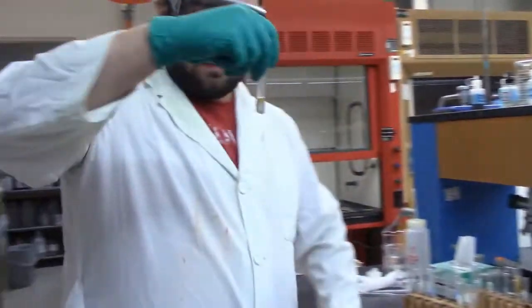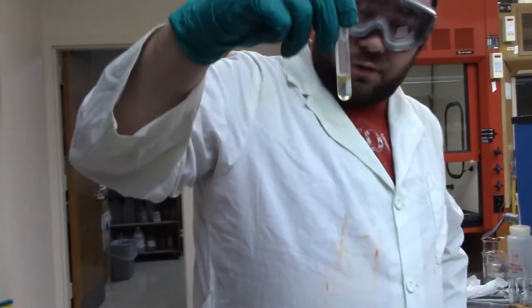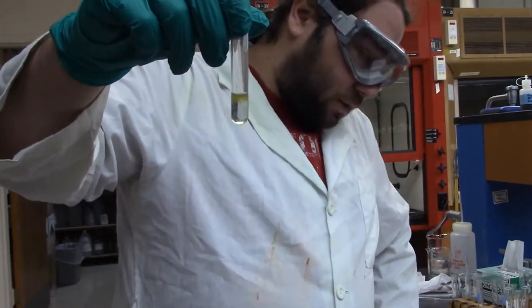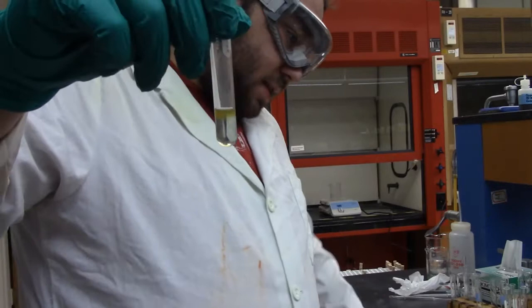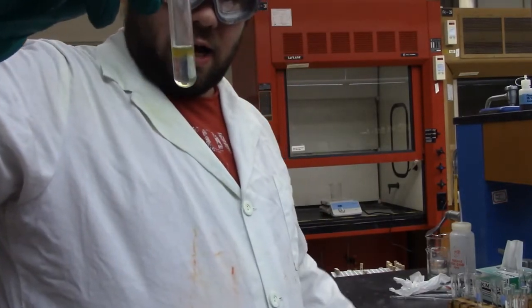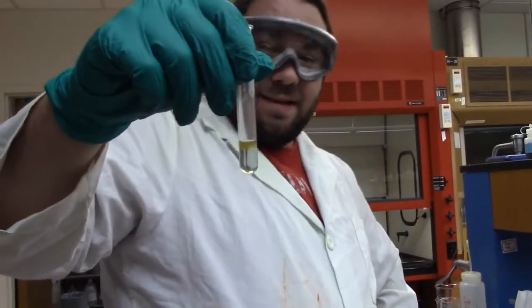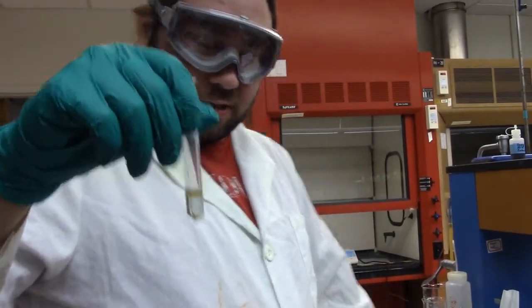And this one is one that we're going to use to test for nickel, and when I did it a second ago, there wasn't that brown precipitate there, but now there's a little bit of it forming. That is the iron hydroxide they talk about in the thing, but it's not all that much. So I'm good to just ignore it.